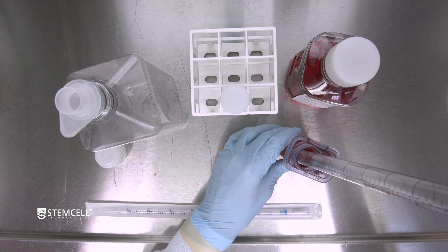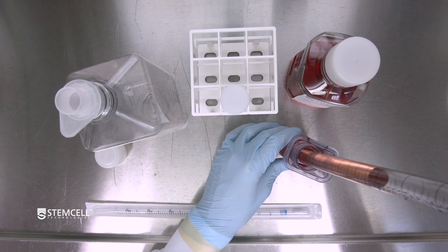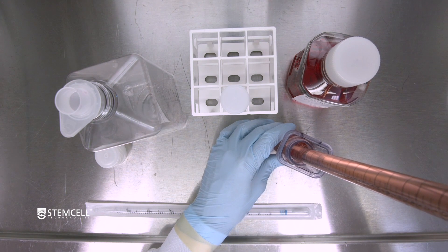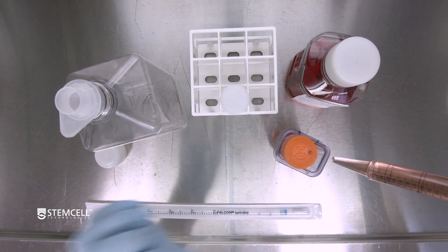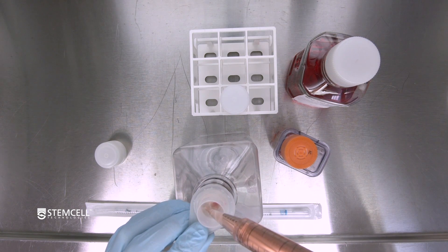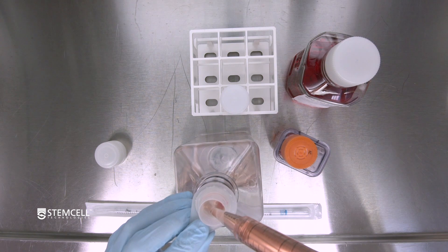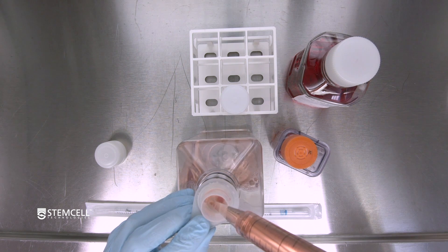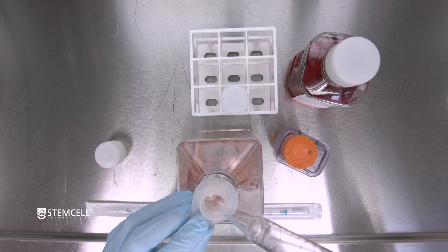Once the aggregates have settled in the bottom of the vessel, carefully aspirate 50 to 70% of the spent media — in this case, we're taking 60 mls of media. Pass the spent media through the filter into the waste bottle. Any aggregates will be captured on the filter.